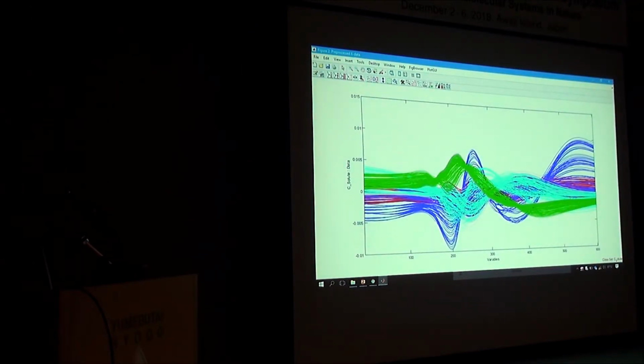So it's similar to that one principal component analysis case. There's clearing up, but not enough. So how are you generally doing the optimization? You're trying different levels? It depends on the aim. If the aim is to predict unknowns, you want to have a maximum classification. If it is quantification, you're looking for the lowest error.